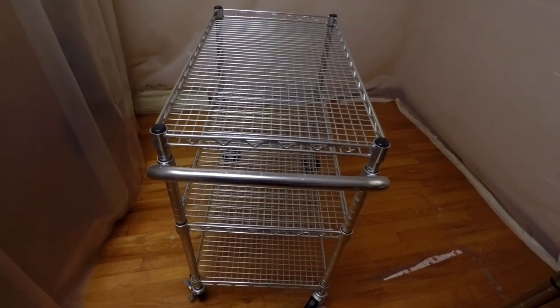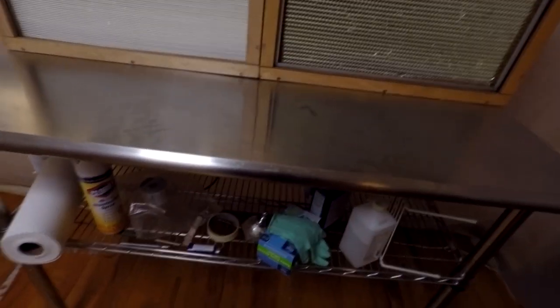I got my cart here, I'll probably rinse that down too. Anything on this table underneath all this stuff I'm going to wipe down with bleach wipes. Also the underside — even though it's still pretty darn clean — I'm going to wipe it all down with bleach wipes as well.